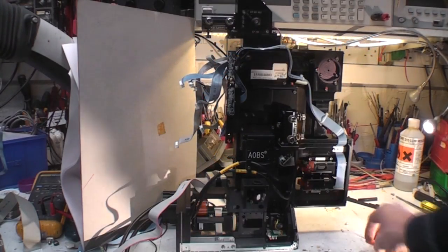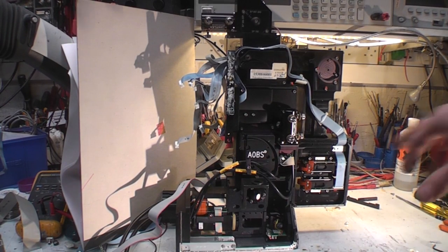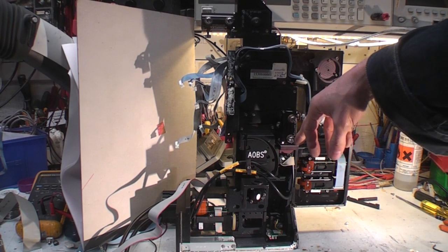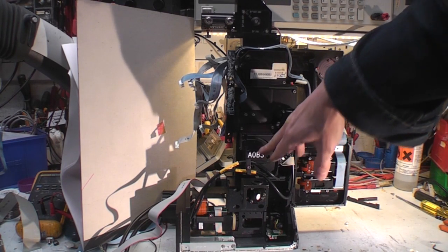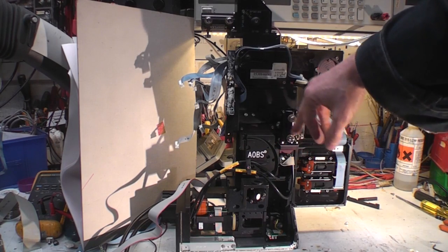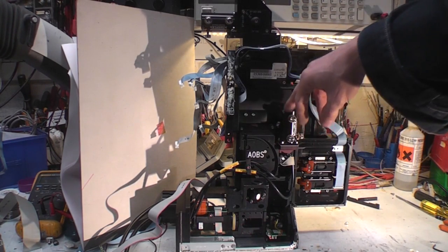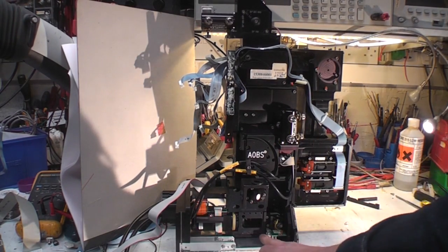Okay, let's see if we can figure out roughly what's where on this, going by that previous diagram. We know the laser comes in here from the box of lasers, and here obviously is the Acousto-optical beam splitter, so this is where the light path is split between the light going down towards the sample and coming back up for analysis. And so it goes down here.